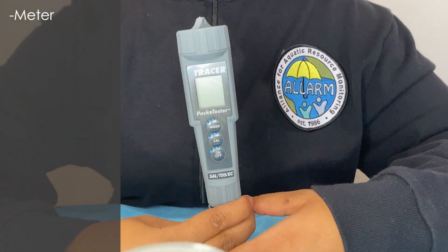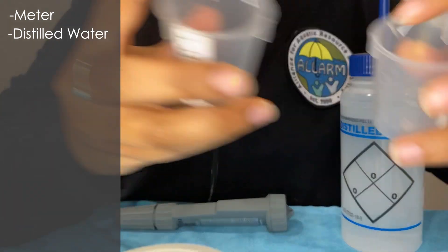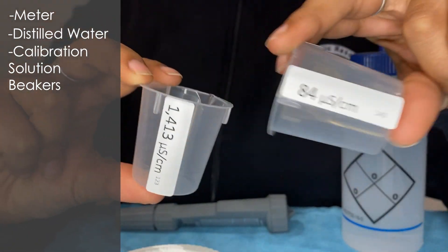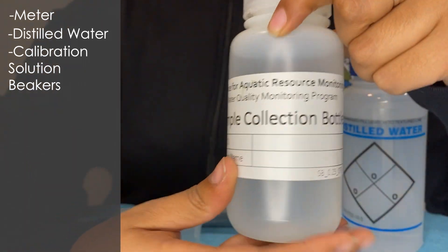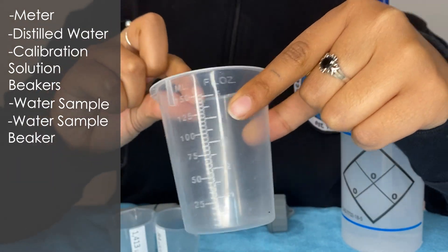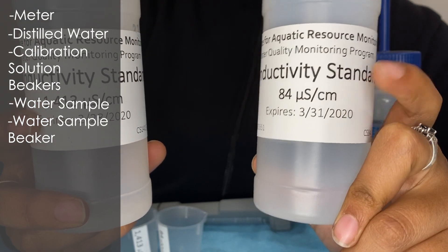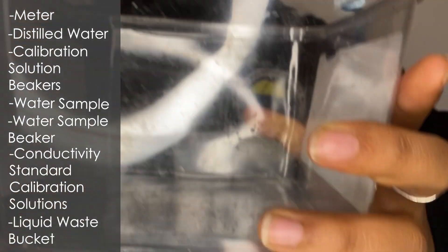Now that we have oriented ourselves to the meter's parts, we can go into calibrating the meter for testing. For calibrating your meter and conducting tests on your water sample, you will need the LaMotte Tracer Pocket Tester, distilled water, calibration solution beakers for your 84 microsiemens per centimeter solution and 1413 microsiemens per centimeter solution, your water sample, a beaker for your water sample, the conductivity standard calibration solution in both 84 microsiemens per centimeter and 1413 microsiemens per centimeter, and a liquid waste bucket.